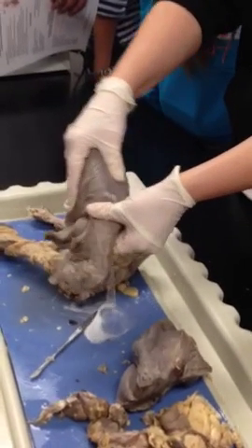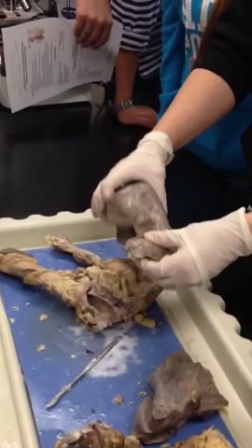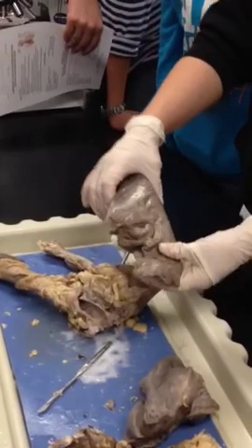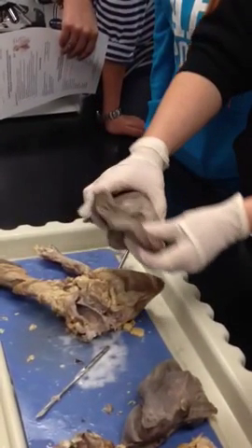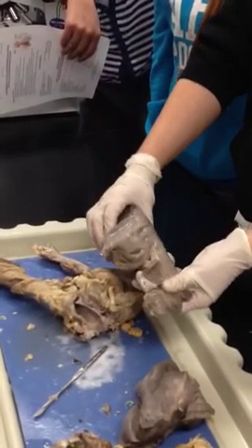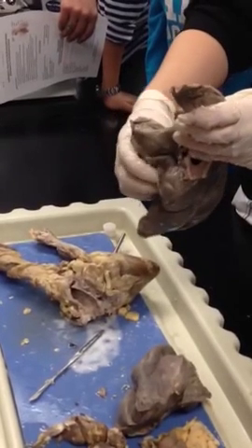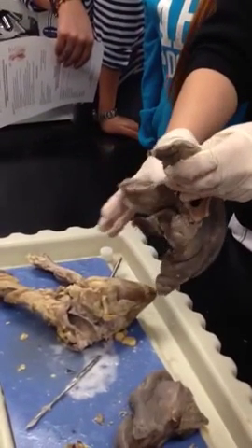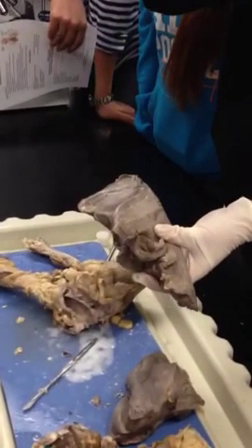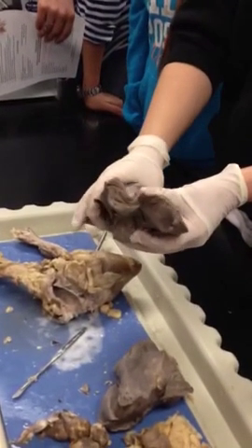Remember that it's opposite. Sorry. It's opposite in a human, so don't confuse it. We can ask you about the lobes on the model as well. Remember that it's opposite on the model than it is on the sheep lung. I know it's really mean. If you're talking about fissures here, technically this would be your horizontal and this would be your oblique, but I guess we're not going to ask you that on this one. So make sure you can identify the horizontal or oblique fissure on the model.